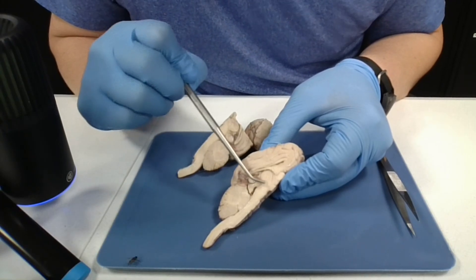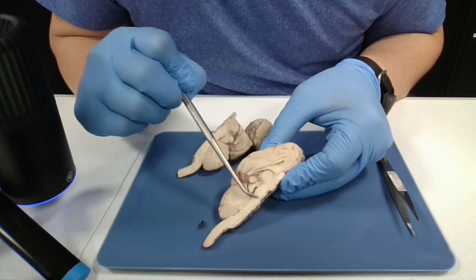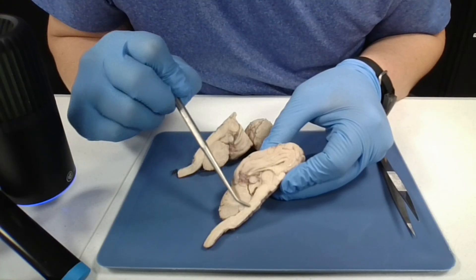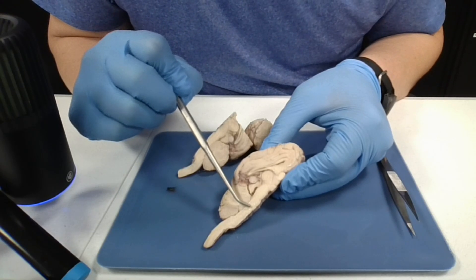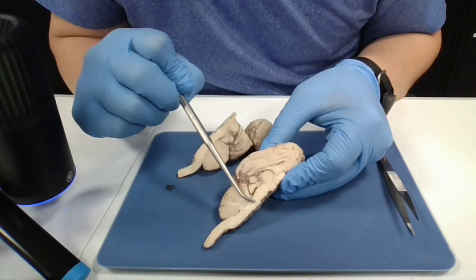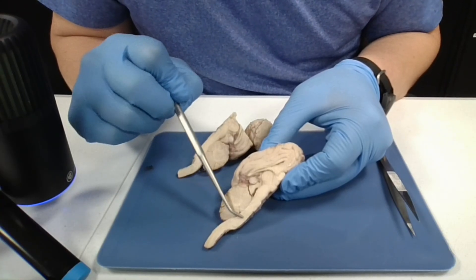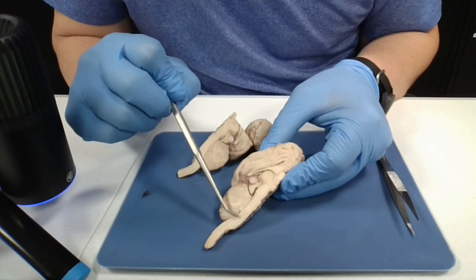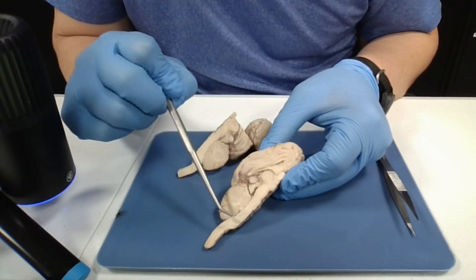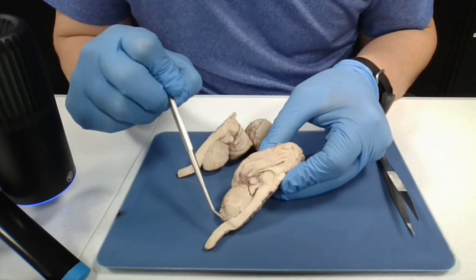Next to the hypothalamus, we have the midbrain right here. And after the midbrain, we have the pons. The pons is an important nerve tract connecting the cerebellum with other parts of the brain and spinal cord. After the pons, we have the medulla oblongata, and that controls heart rate, blood pressure, respiration, and reflex centers for coughing and sneezing. And from that, we have the spinal cord.